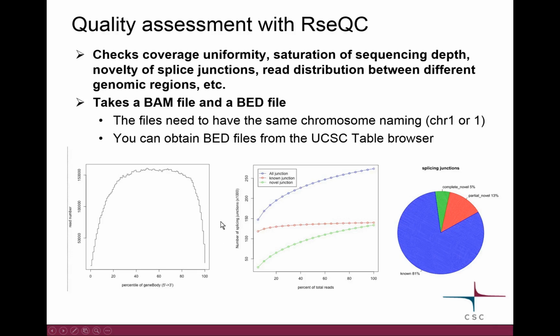Here you have the gene body, and this is the number of the reads in that area. So this is a pretty nice example where the coverage is pretty uniform. Maybe a little bit of lacking coverage here at the beginning of the read. If we would have some sort of bias here, it would look maybe a little more like this. And you get to see these soon when you do the exercises.